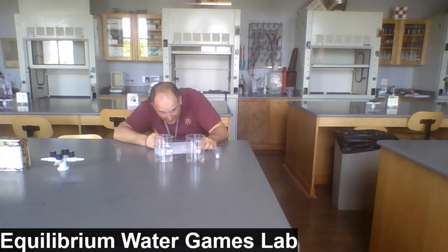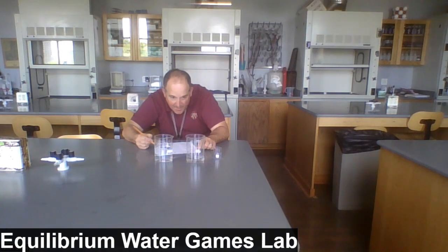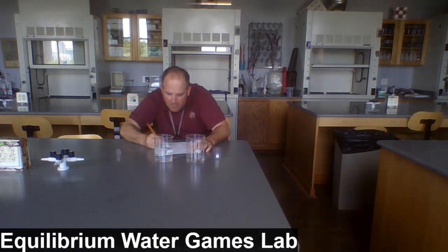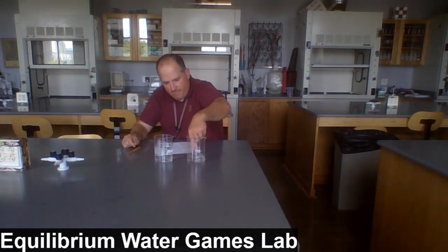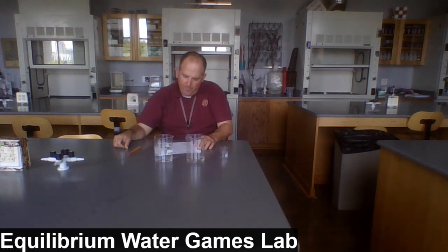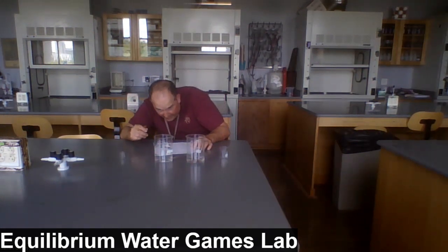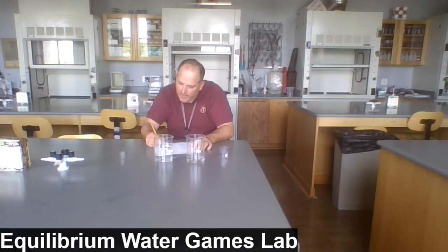And I'd say we're at 90 in beaker A. This is after transfer cycle 6. 90 in beaker A and 410 in beaker B. After transfer cycle 6, oh, well, we're still at 90 and 410.